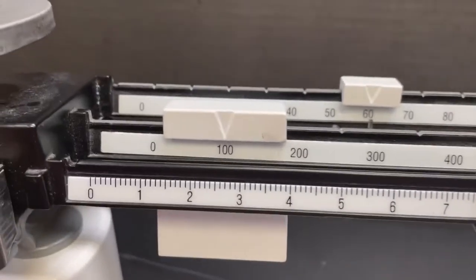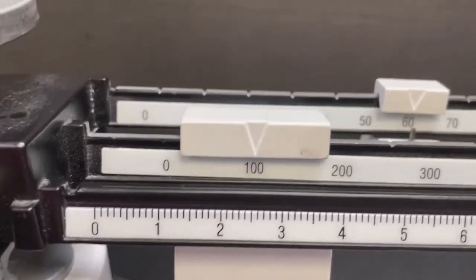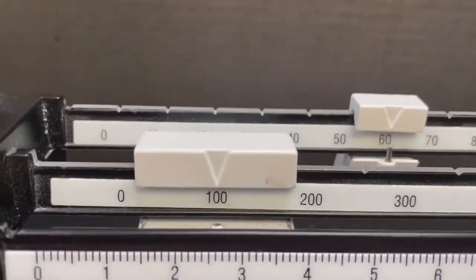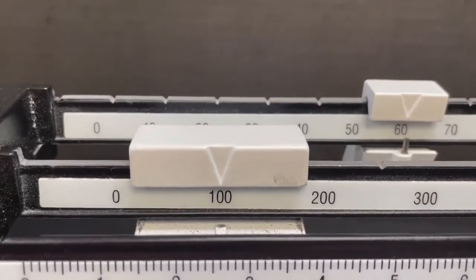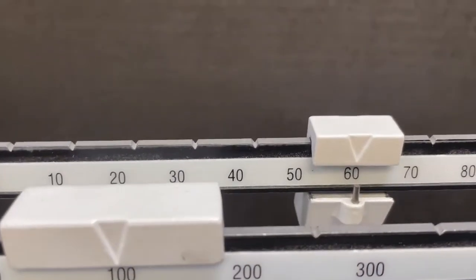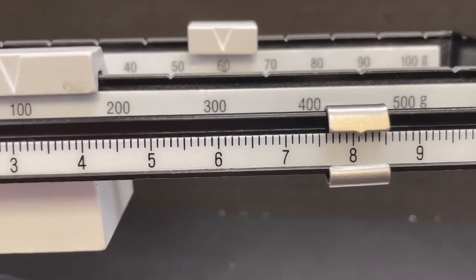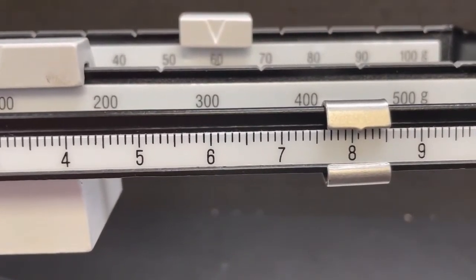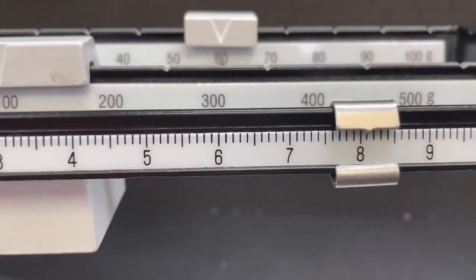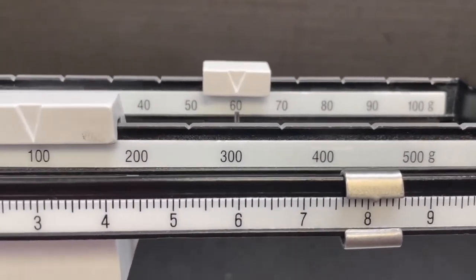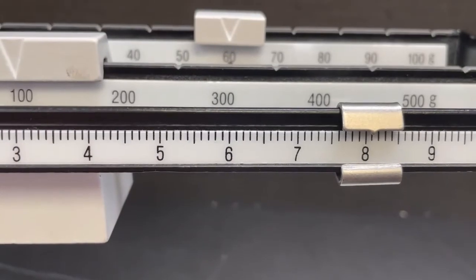The way to get the actual measurement is you add all three weights together. You want to have 100 grams plus 60, and this down here then is 8.1, so the total weight is going to be 168.1 grams.